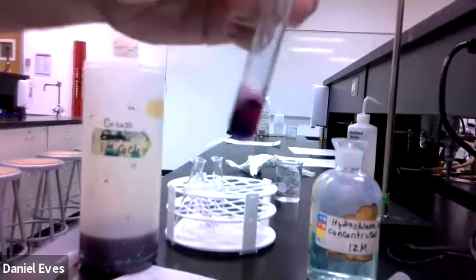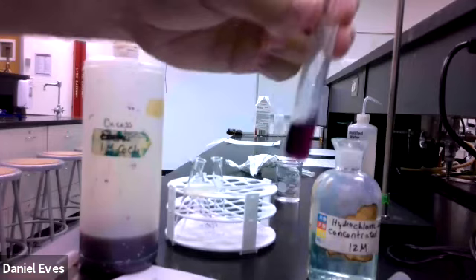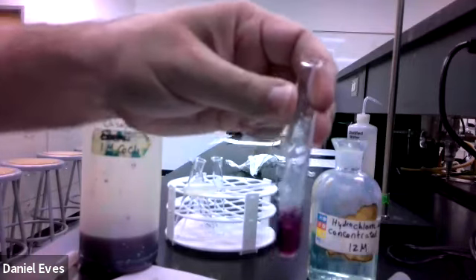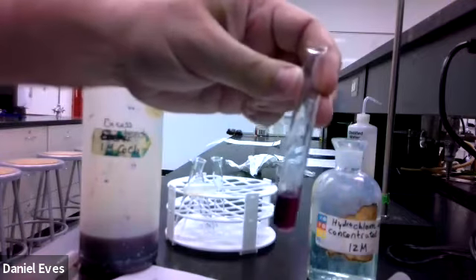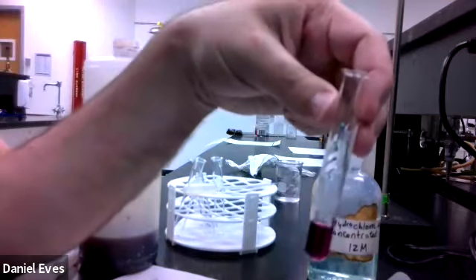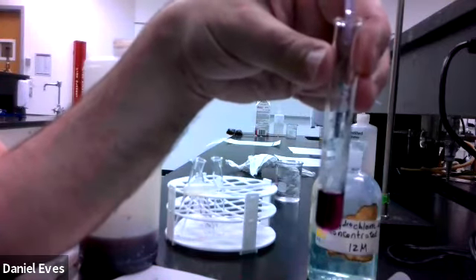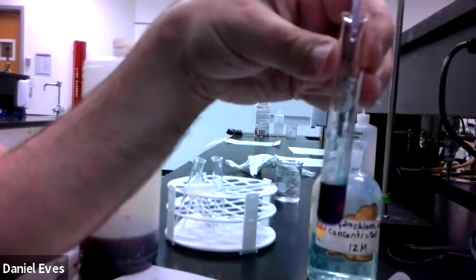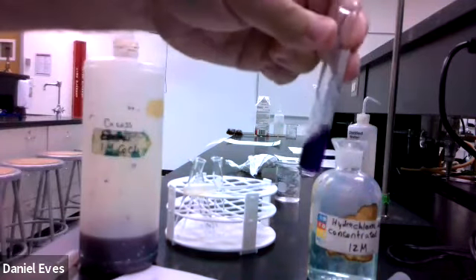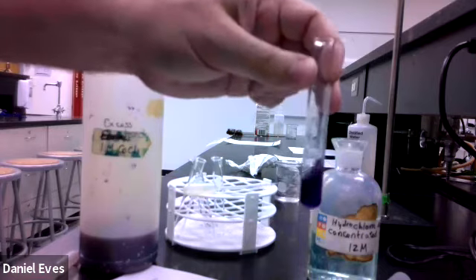We'll go ahead and give that a stir. Okay, so with 15 drops of hydrochloric acid, it has that purple color to it. So we're making a different compound, and we're surrounding all of the cobalts with chlorine. So let's just give it a couple more drops. There's 16, 17, 18, 19, 20. Okay, so now it's starting to turn deeper purple.